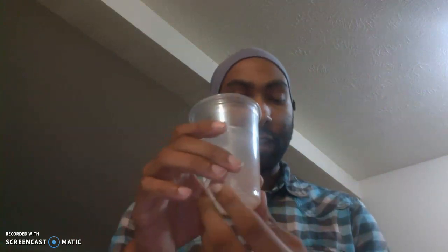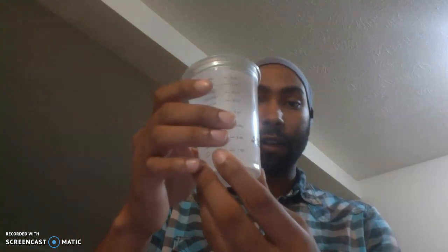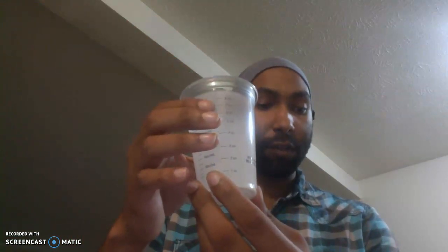And so iodine, it's I2, plus the vitamin C. The reaction happening there is you get iodide ion and a hydrogen proton, which is acidic. And then in this solution B, as I'll call it, we have some water and hydrogen peroxide, H2O2. And we have some cornstarch mixed in there.